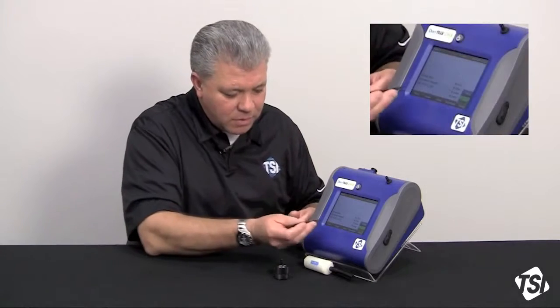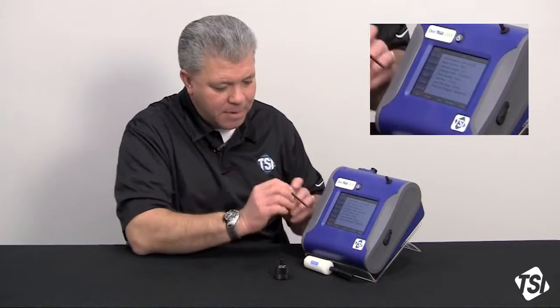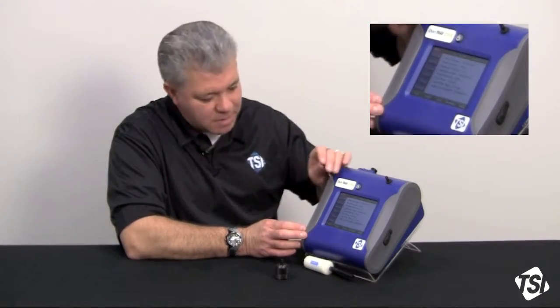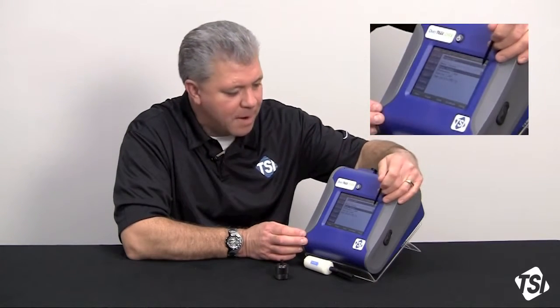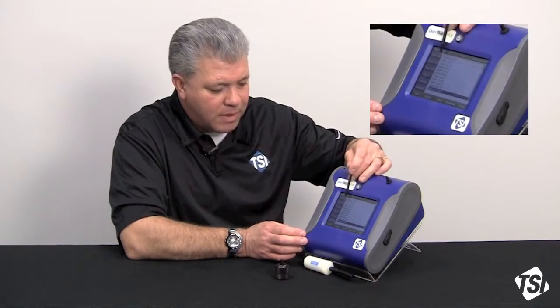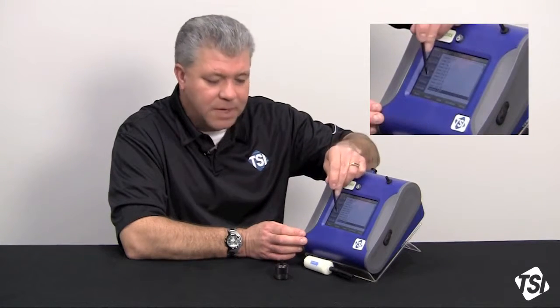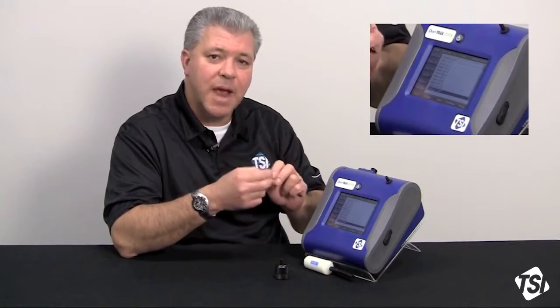So we're going to utilize the lower setup screen here. I'm going to press the setup tab, and across the left side of the instrument we're going to see another row of icons come up. We're going to go to the user cal icon. From the upper drop-down menu, the top option is factory cal — that's the factory calibration put into the instrument — and then there are ten user calibrations. In these user calibrations there are two different correction factors: one is a photometric correction factor and the other is the size correction factor.